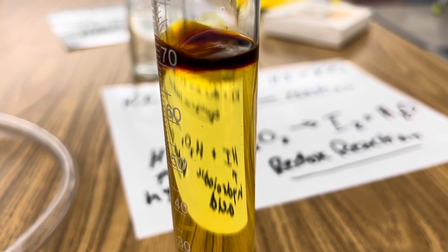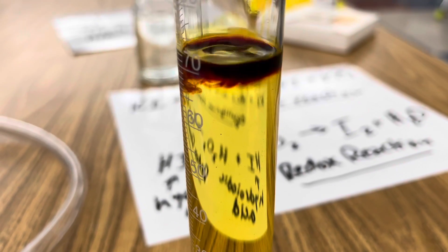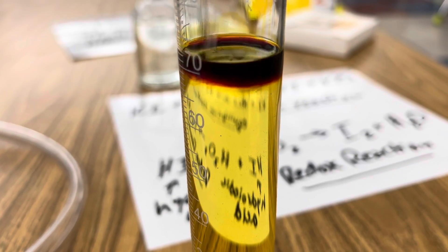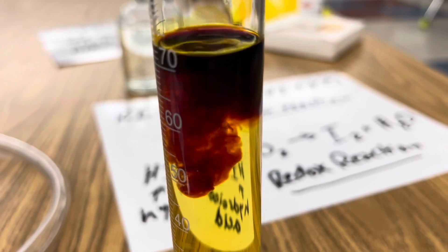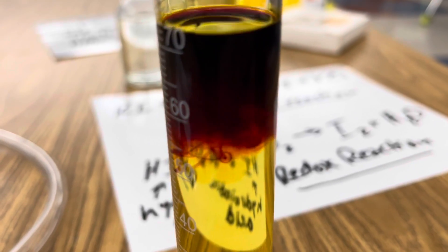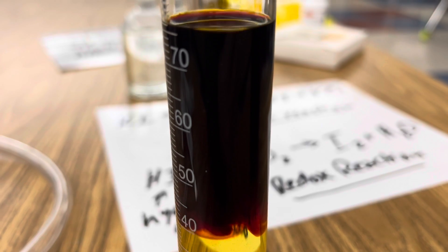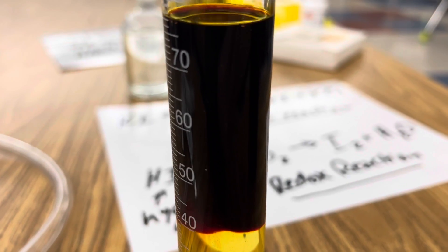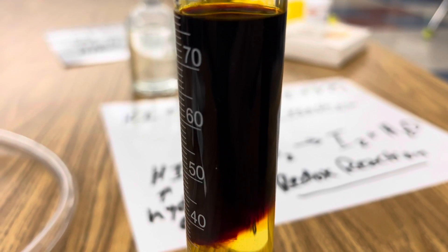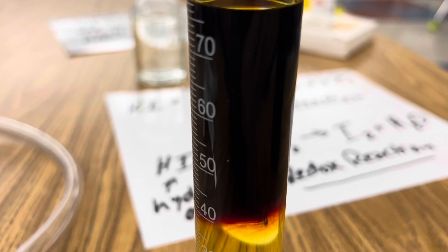Right away, you can see that iodine starting to precipitate out of the solution. Isn't that amazing? All I'm doing is just oxidizing the hydroiodic acid with hydrogen peroxide.